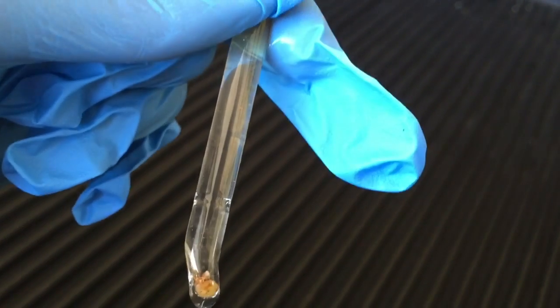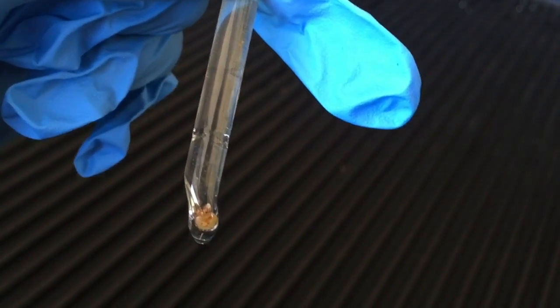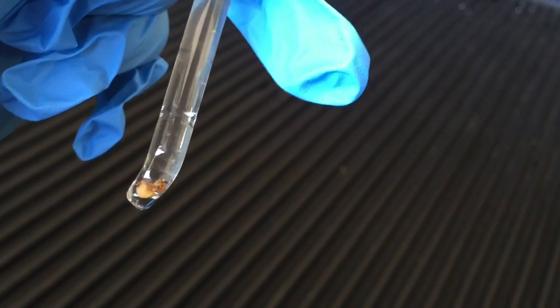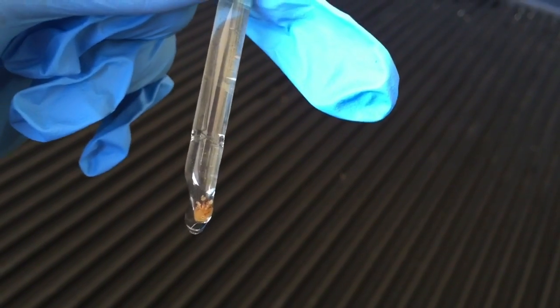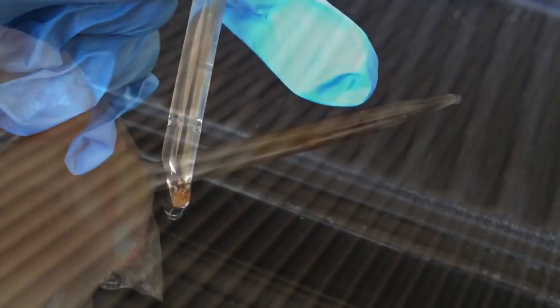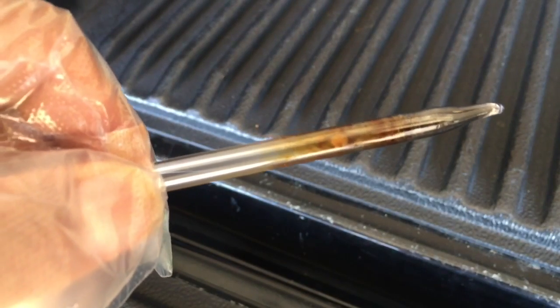What I plan to do now is fill this tube, when I take out some of the water, fill this tube with argon, and then what I plan to do is seal the top end of the tube. Okay, here's another batch that I just put together.